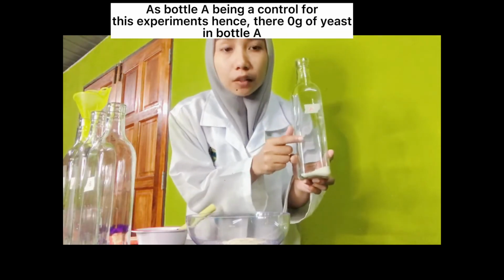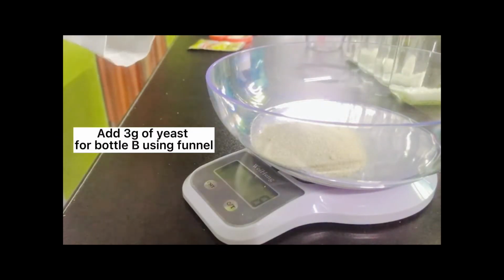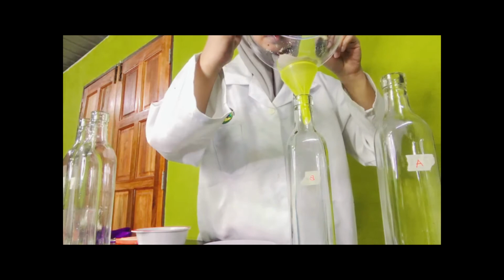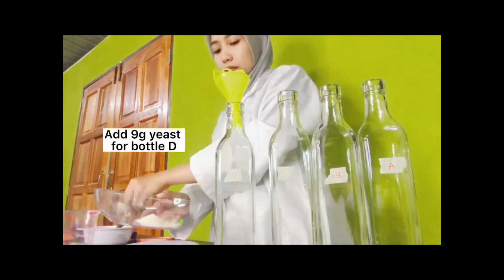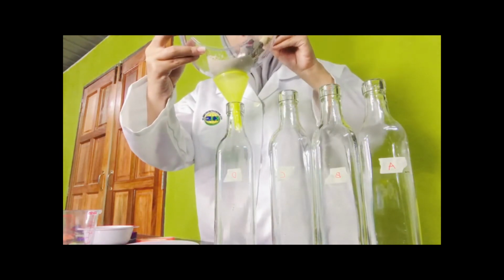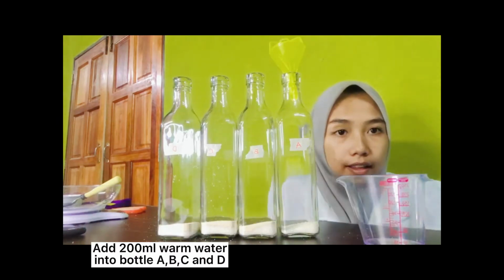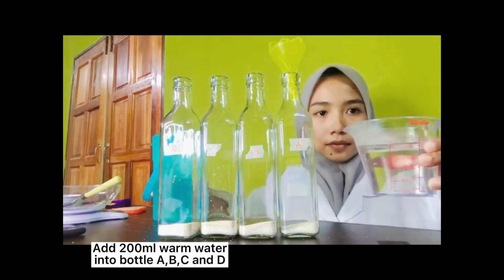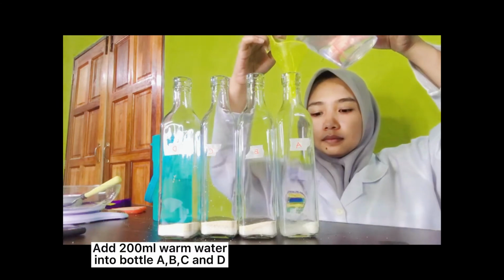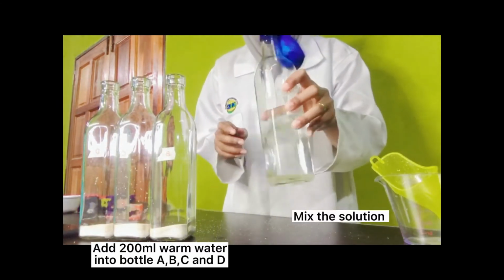There will be no yeast for bottle A. We must put our eyes in line with the 200 ml mark. Pour into bottle A. Now take a balloon and put it on the bottle mouth and shake it. Mix the solution.